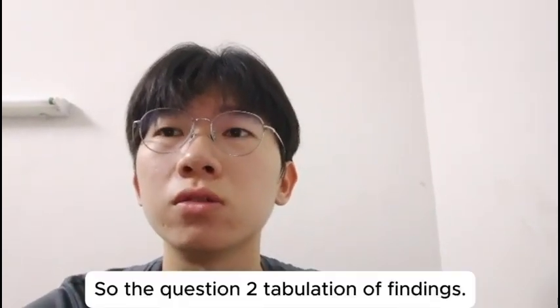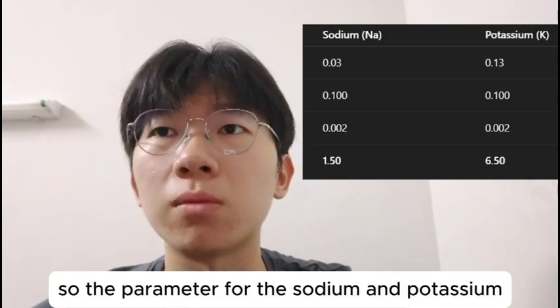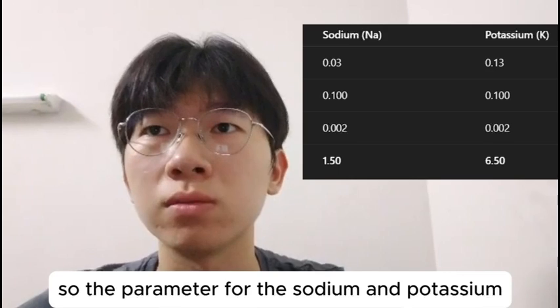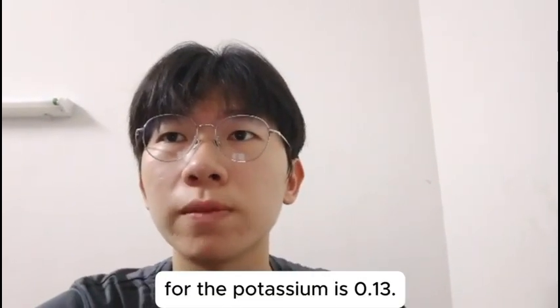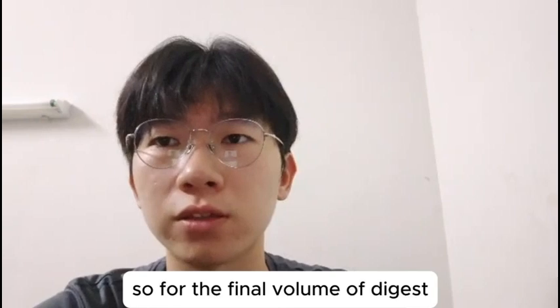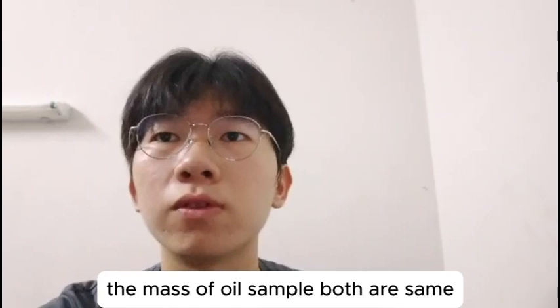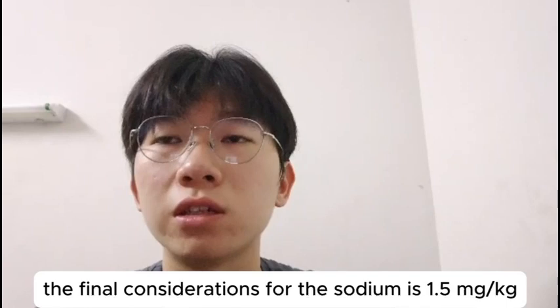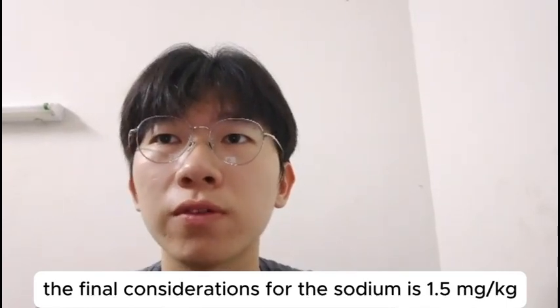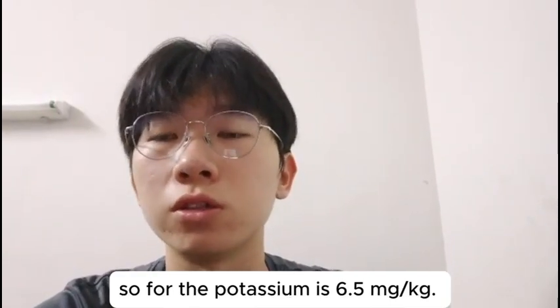So question 2, tabulation of findings. For the parameters of sodium and potassium, the concentration from calibration for sodium is 0.03, and for potassium is 0.13. The final volume of digest, both are the same, that is 0.1 liter. The mass of oil sample, both are the same, that is 0.02 kg. So the final concentration for sodium is 1.5 mg over kg, and for potassium is 6.5 mg over kg.